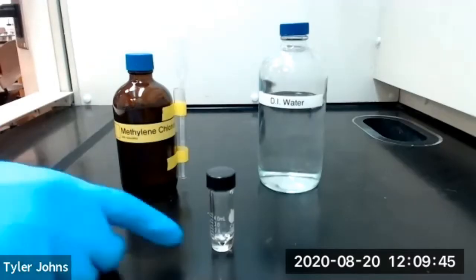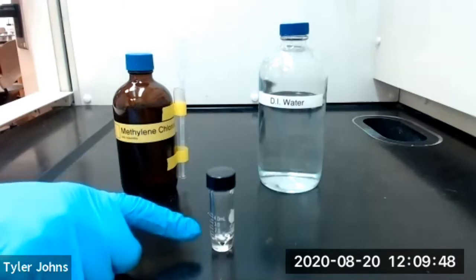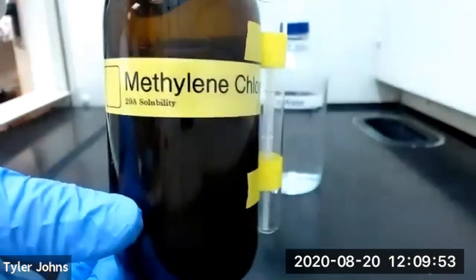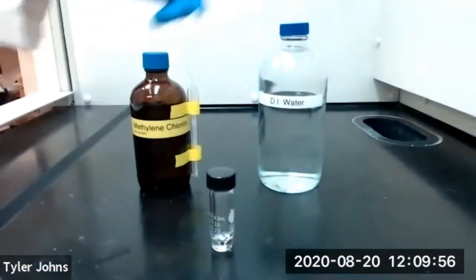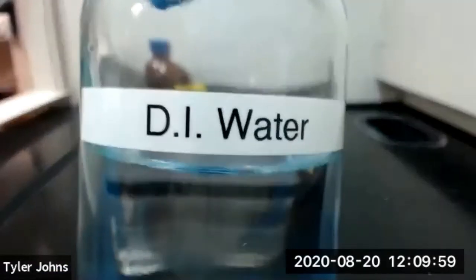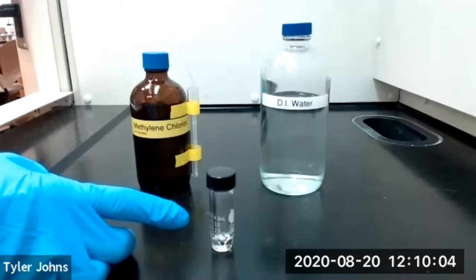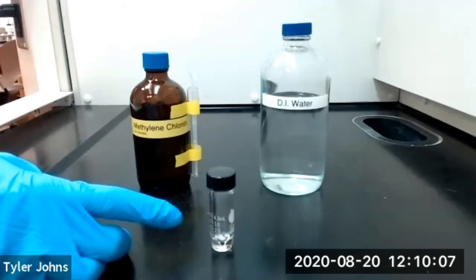We've added approximately 50 milligrams of benzoic acid to our conical vial. We'll now add two milliliters of methylene chloride and two milliliters of deionized water to our conical vial, then cap and shake to mix for approximately one minute or until all the solid has dissolved.